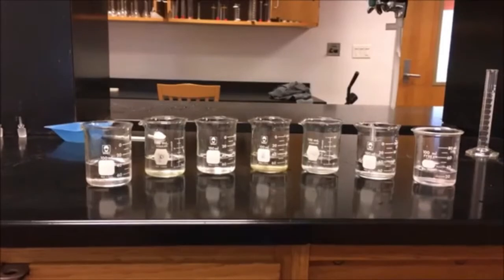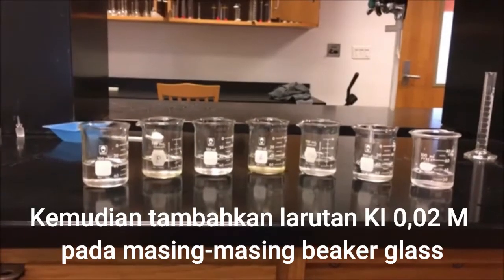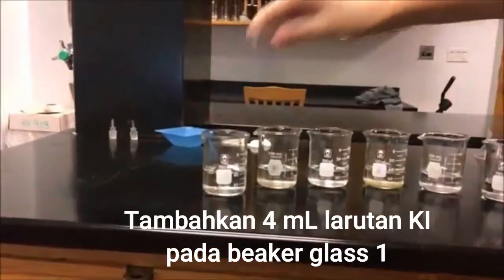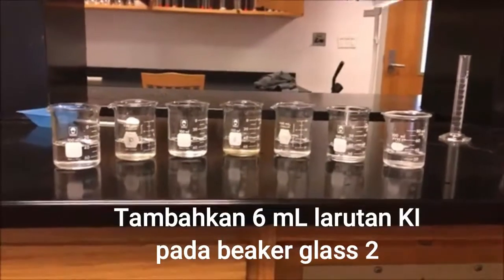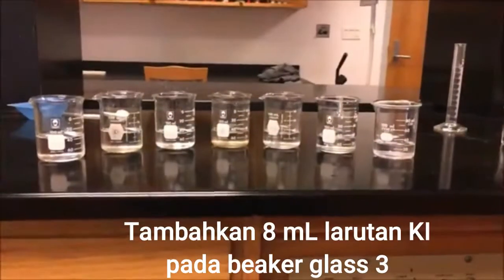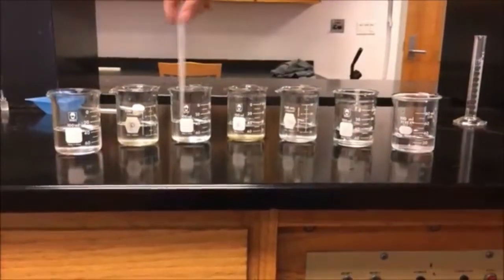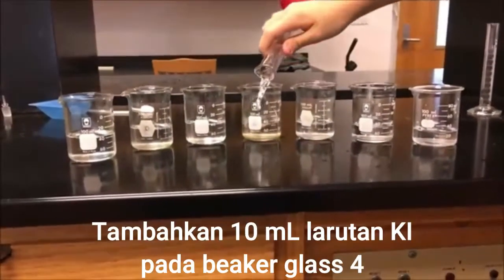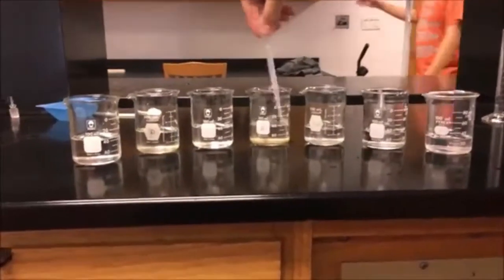Now we have to add potassium iodide to figure out which beaker is the one closest to KSP. Add 4 milliliters of KI to the first beaker, 6 milliliters of KI to the second beaker, 8 milliliters of KI to the third beaker. None of these form any precipitate. Add 10.5 milliliters to the fourth beaker, and you can tell it precipitates because it turns a little bit yellow.